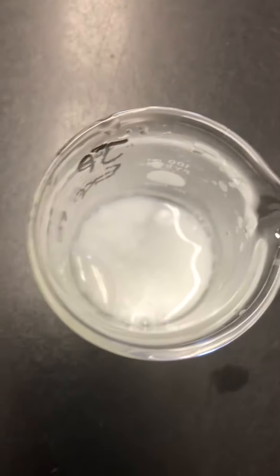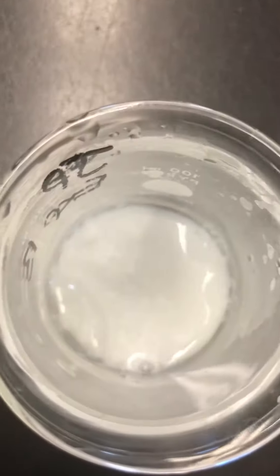We'll let that one go for another minute or so. This is the result of the one with water — it's also warm to the touch. And this is our one with acid.